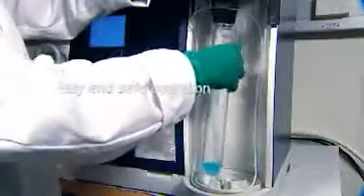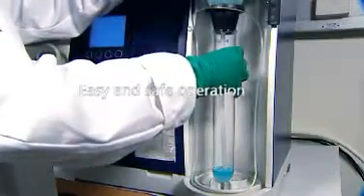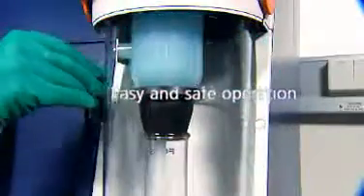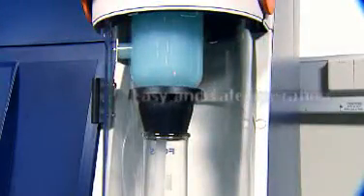Just load your sample tube, place the receiver solution flask, and close the door. Sensors for tube in place and the safety door ensure safe operation.